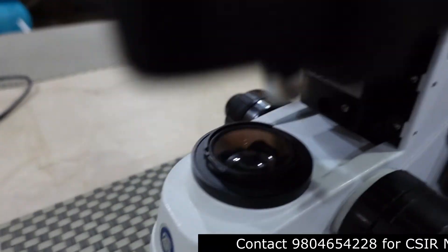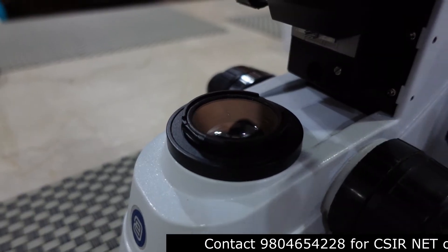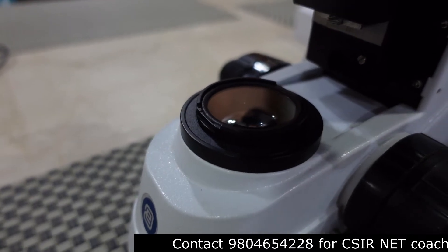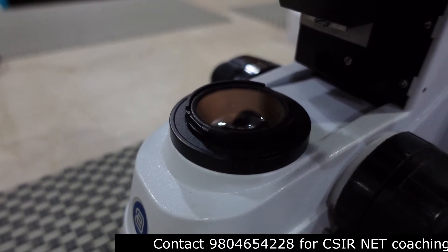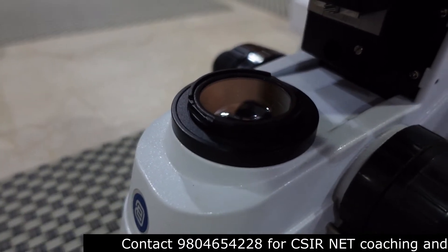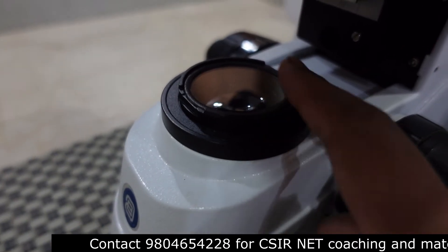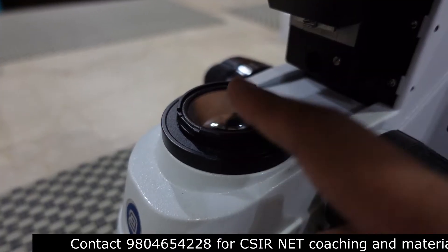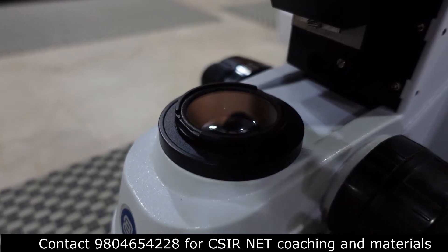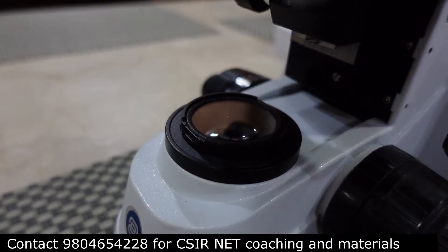Halogen light sources give a very warm color and heat up quite easily, which is why we no longer use them. We now only use LED light sources, which give a cool daylight color. If you are using a halogen light source, you need to use a blue filter in the condenser diaphragm setting so the background isn't yellowish.